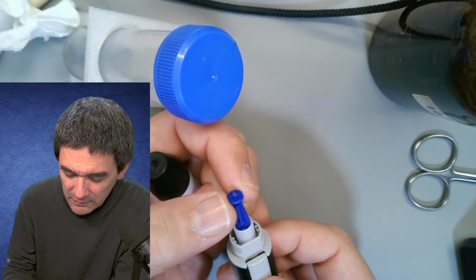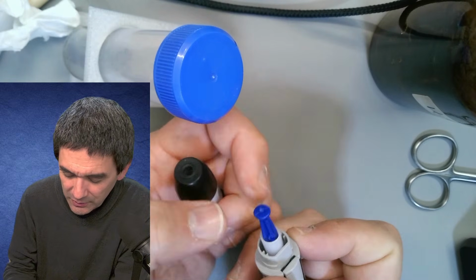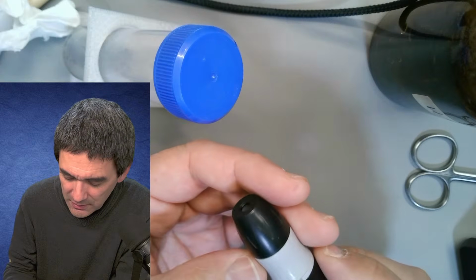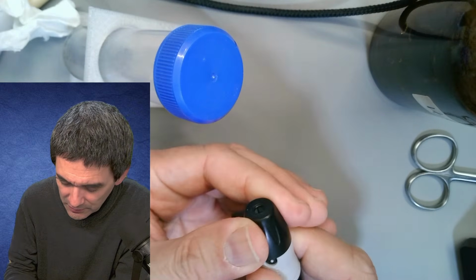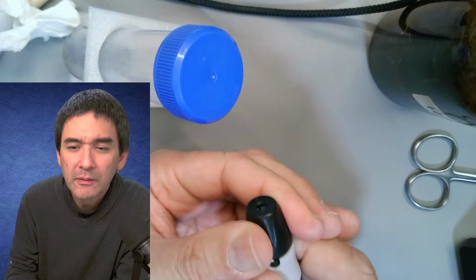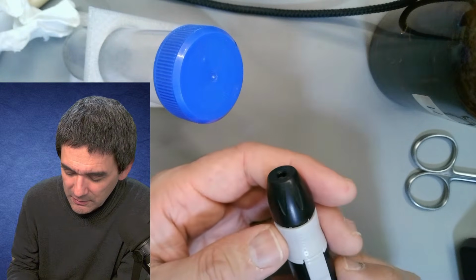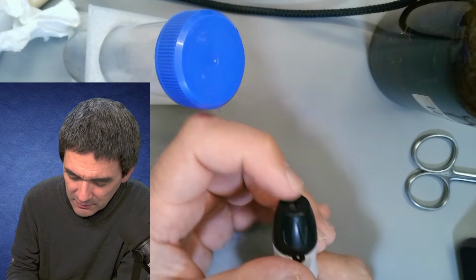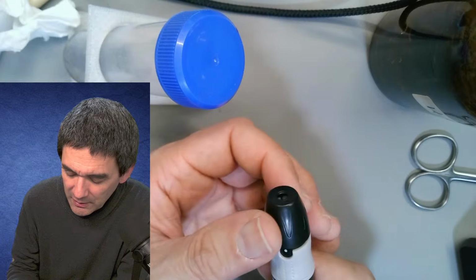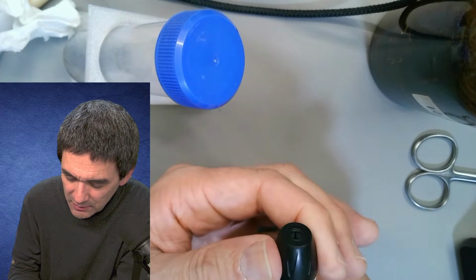All the way. Okay, but then nothing comes out, I thought. I don't know. Or maybe set it to 0 or to the lowest one. Okay, maybe then you have to pull it back. And then you press. Okay, there's nothing there. So then maybe you have to adjust it in such a way until it starts to appear, I guess.